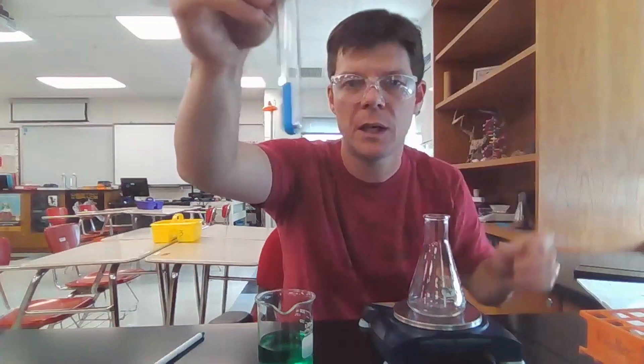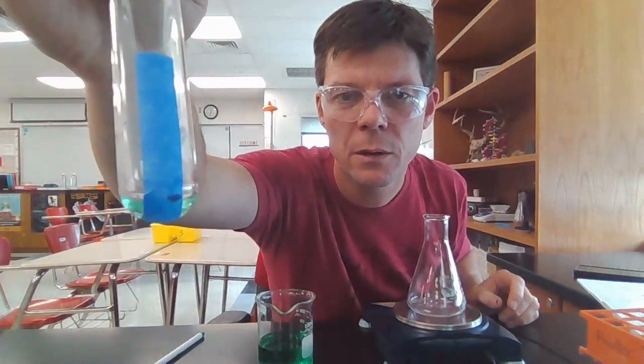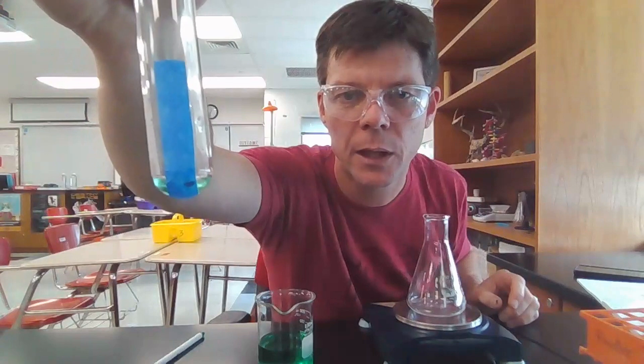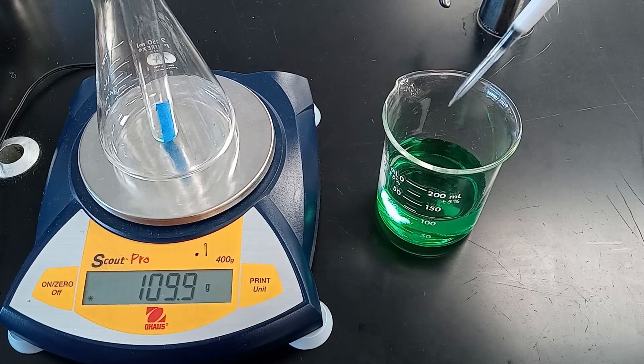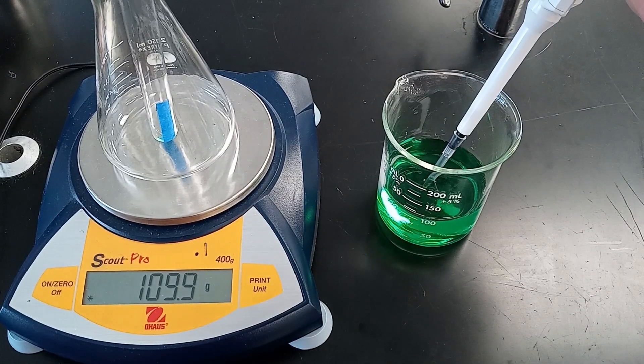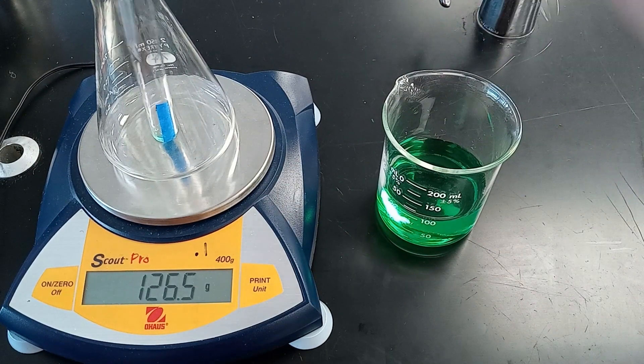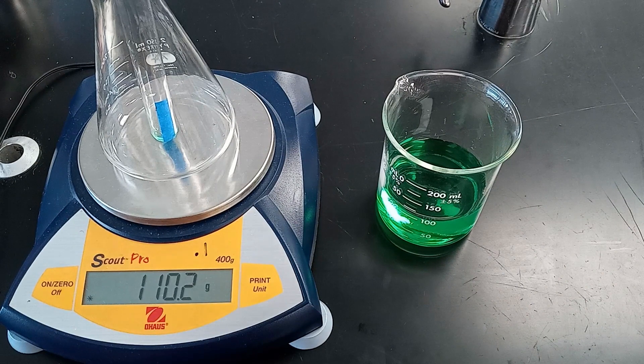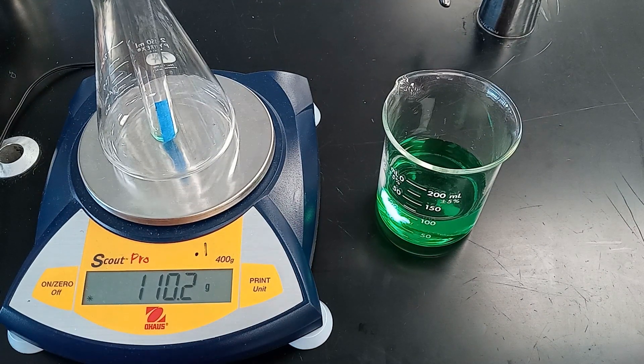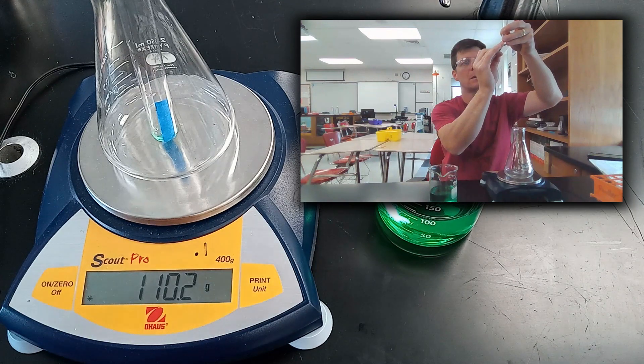If I hold this, you can see I've marked where that liquid level is. First stop point, liquid. First stop, second stop. New mass, 110.2. And we're going to mark the liquid level.